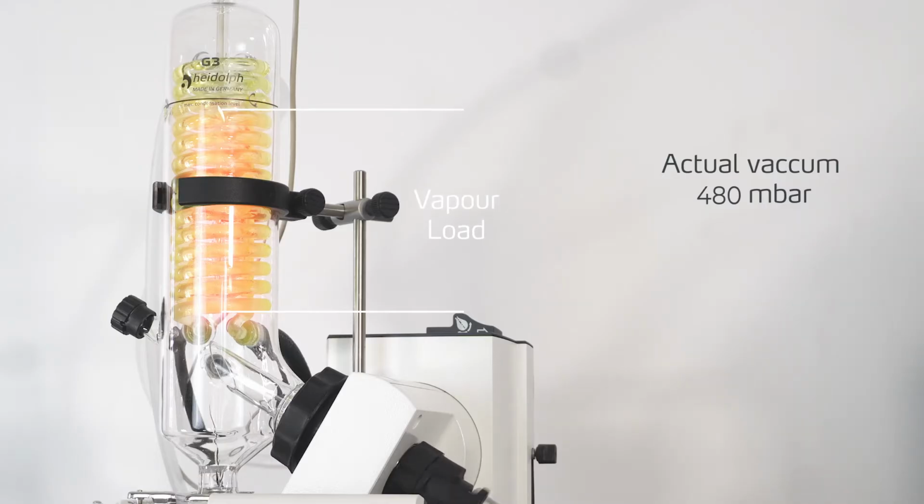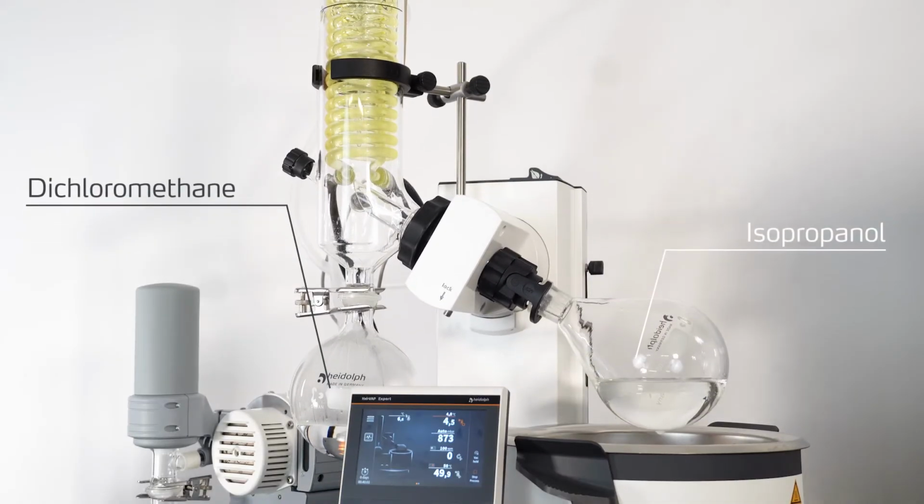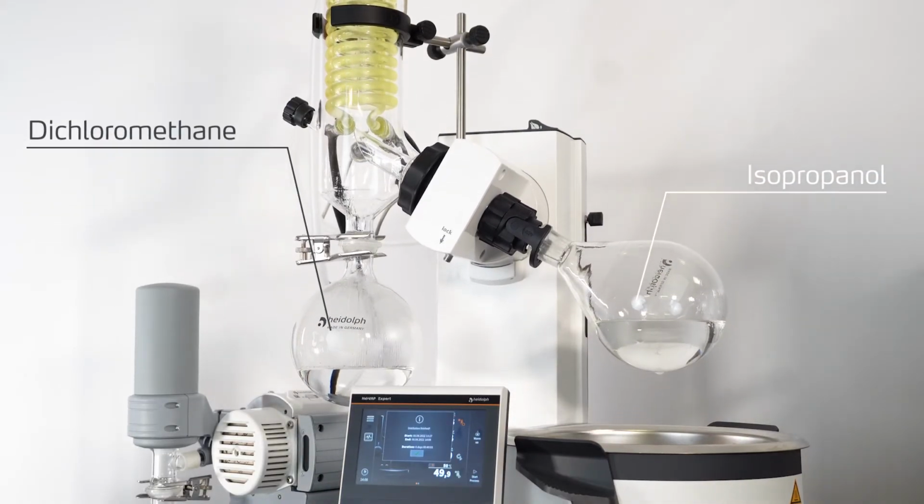The DAA program will adjust the vacuum automatically several times to maintain an efficient and fast evaporation and a good separation from solvent to solvent, or solvent from a solid or powder. At the end, the system detects no vapor load anymore via the recovering temperature level on the sensor and will finish the process automatically.